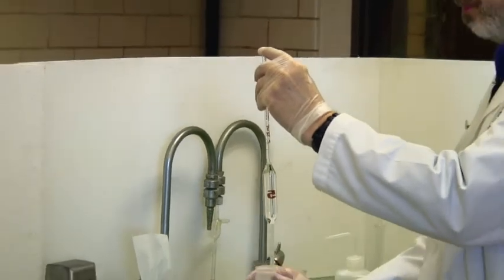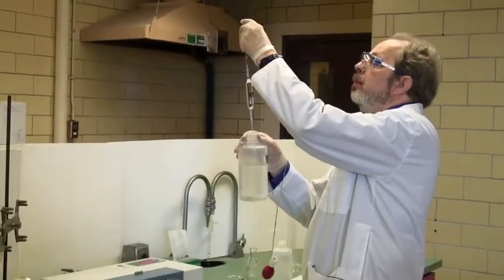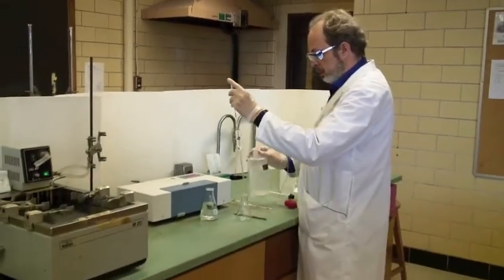All right. Hold this to eye level. 25.0 mils. Touch the tip and dispense.